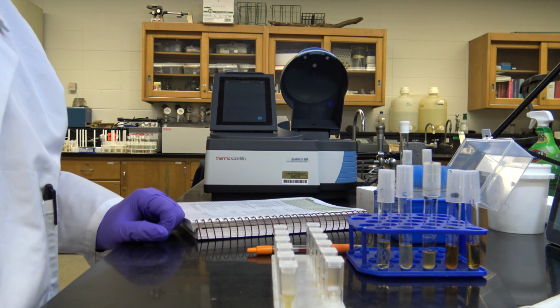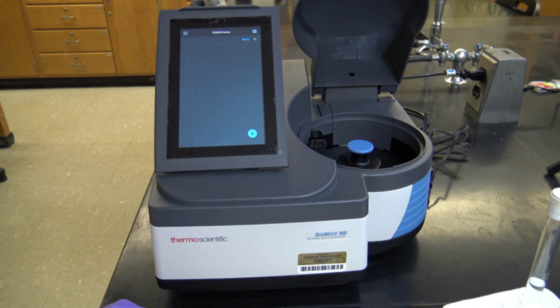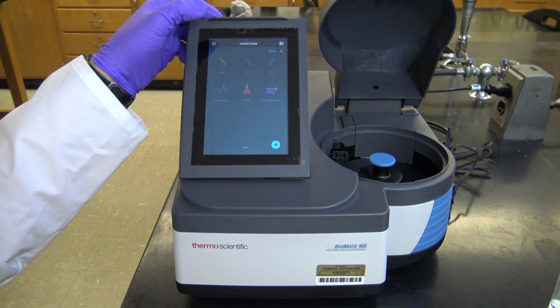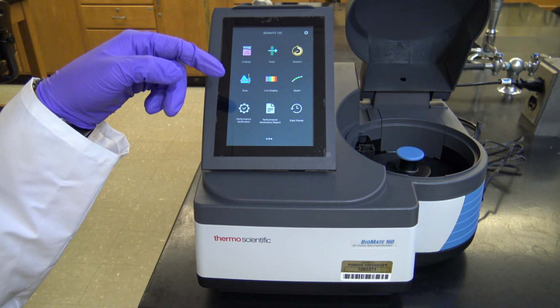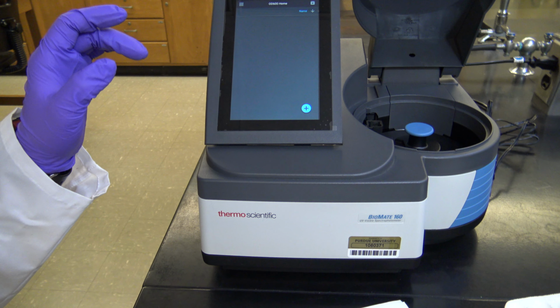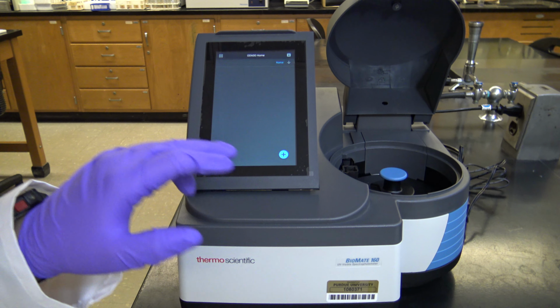So how do we use this? I'm going to go ahead and try to pick you up here. Let's see how well this works. You can see the interface here. I realize it might be a little bit out of focus, but let me step back. I've already selected what I was going to do. You could still run fixed, or you could still run one at a time if you wanted to, but you don't have to. What I've done here is I've picked OD600, which is pre-made for running bacteria. It's going to run at 600, but I can edit that too.